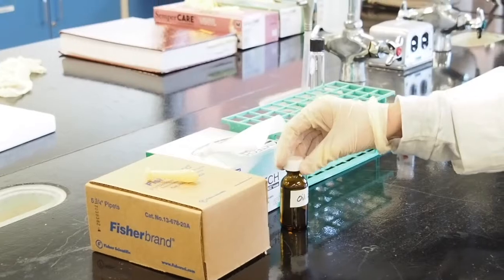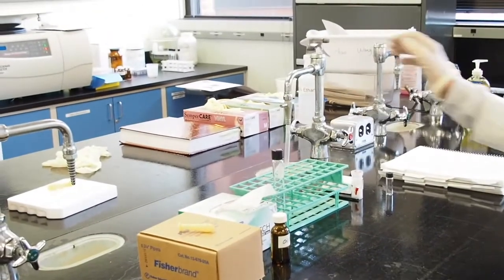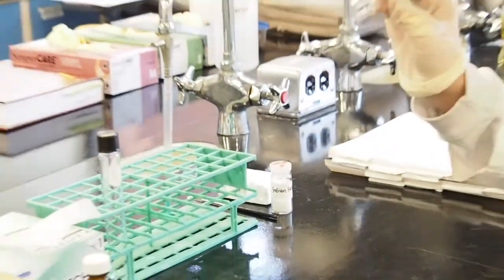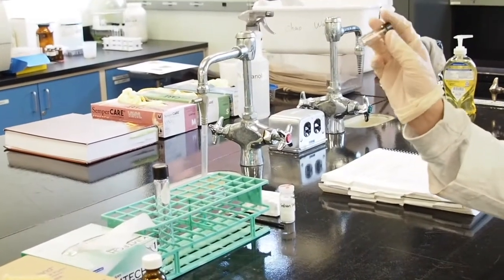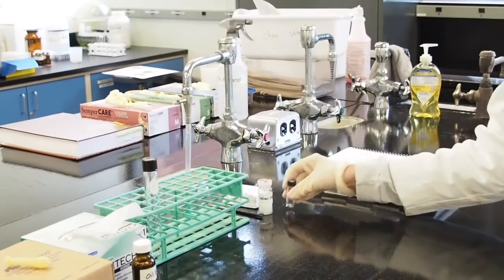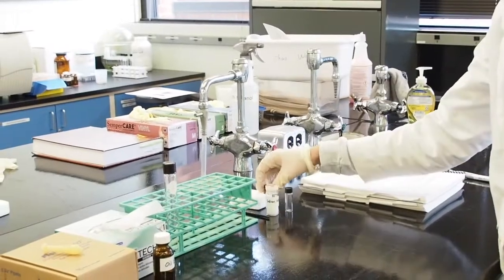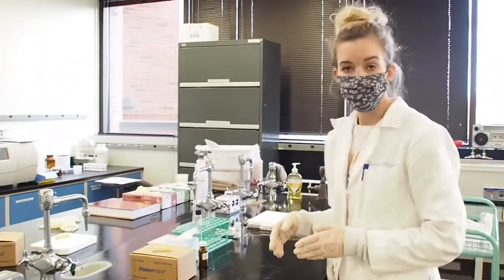This one is E. And then you'll have a glass screw cap tube, and then over here you will have sodium sulfate with a spatula, a 7 milliliter screw cap vial, and then you have your GC vial, and this is for the auto sampler to put your sample in at the end, but we'll get there. So to start, I'm going to walk you through the preparation.